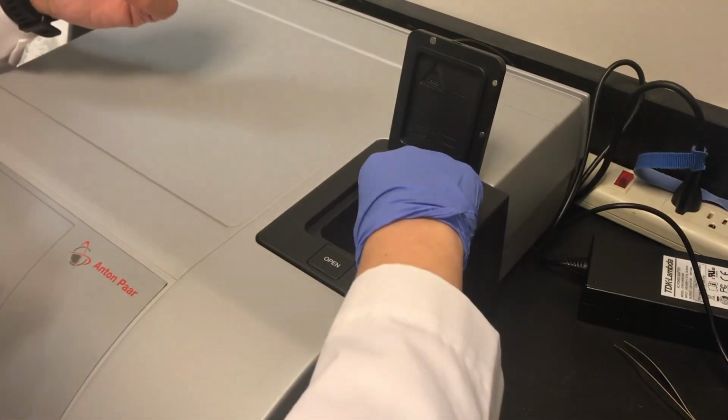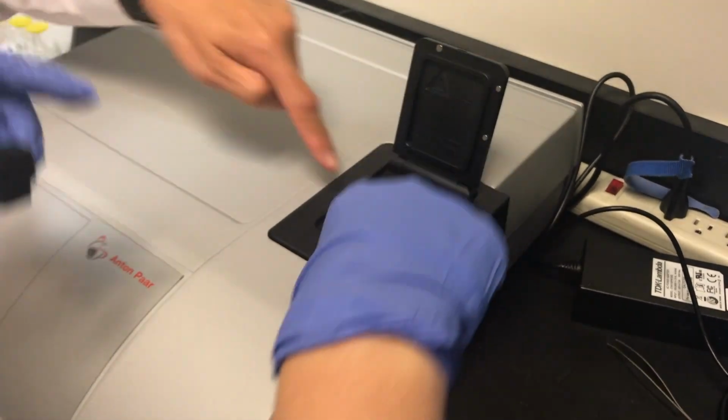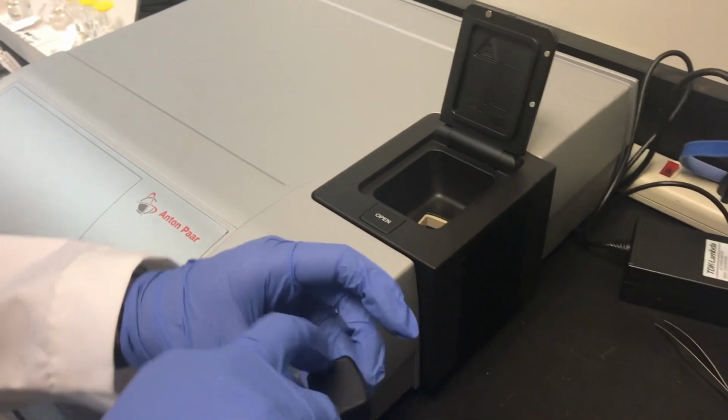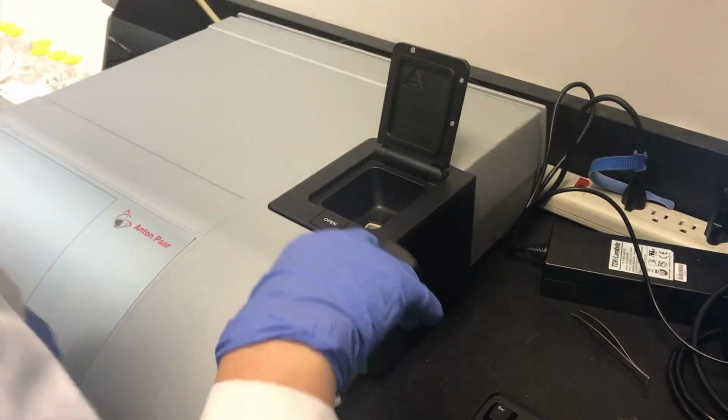Should be fine. So you just pull it out. Okay. I don't know if it can wipe that part of the keyboard. Should that be wiped down every time? No, as long as you don't see any droplets, but here we see a droplet that we just wiped.